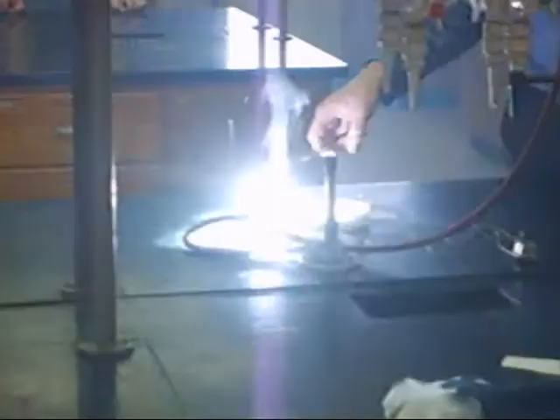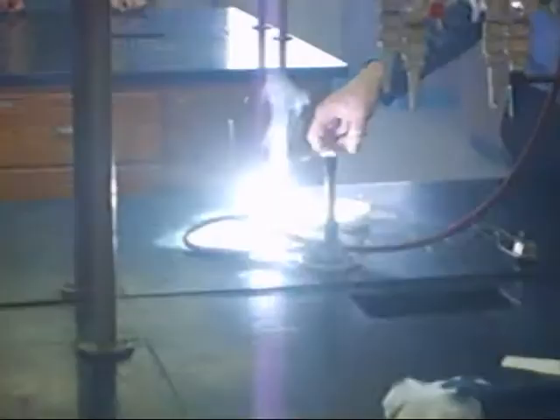Now if I lift this up, I should have a nice little meteorite under here. There we go. Check out that thing. Oh, come over here.